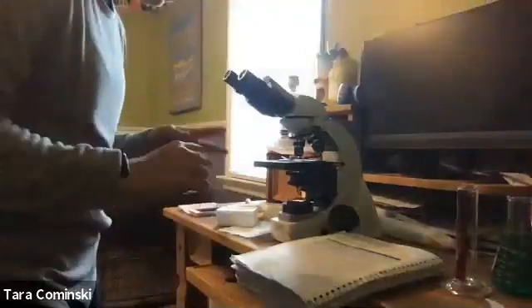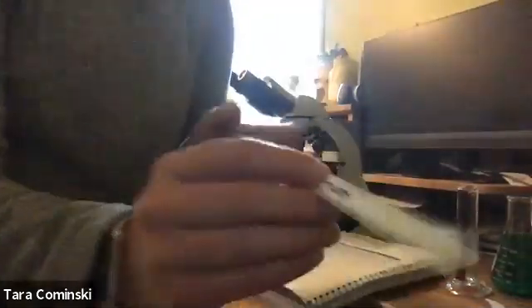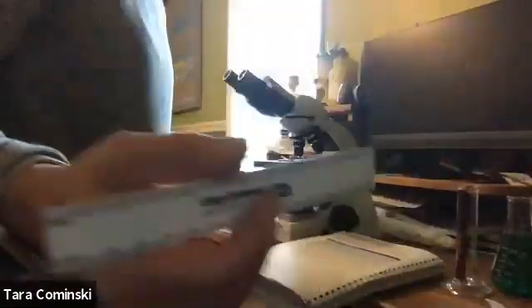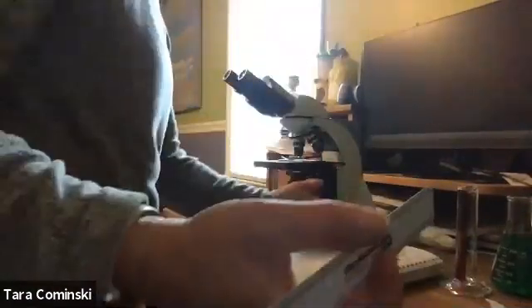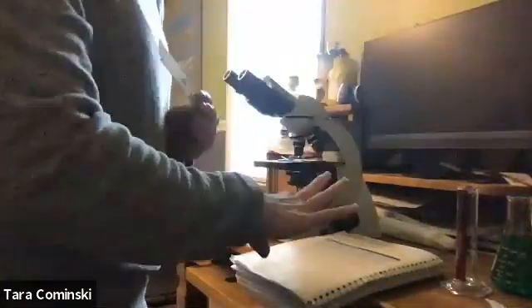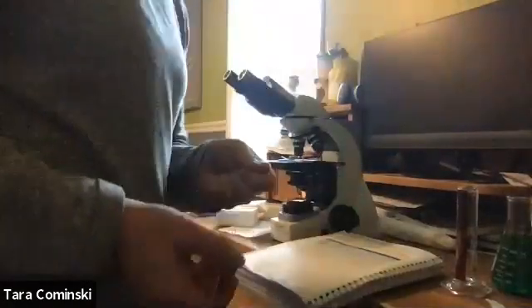The first one says obtain a small ruler. How many centimeters are represented? I just showed you, there are 15 centimeters. And 1 centimeter equals how many millimeters? You need to be filling in this lab completely as we move through, unless I tell you we're skipping something. If you have to pause it and fill it in, that's what you do. I'm not going to pause and give you time, but you can pause the video.